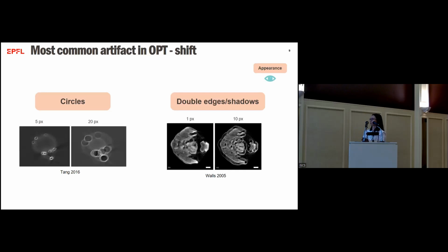And the resulting artifacts come in different shapes. For point-like objects, we see these circles. And for continuous structures, we see these kind of double edges or shadows. In both cases, the larger the shift, the more severe the artifacts are.